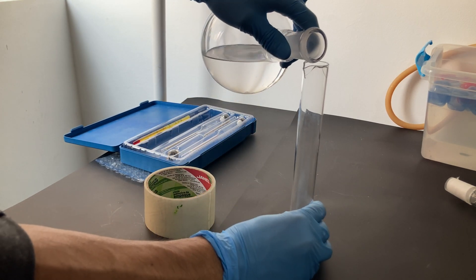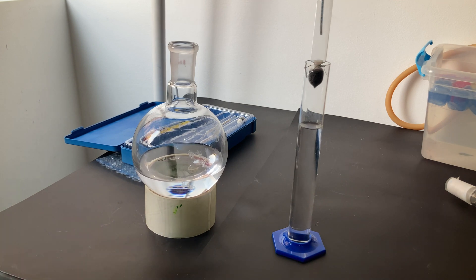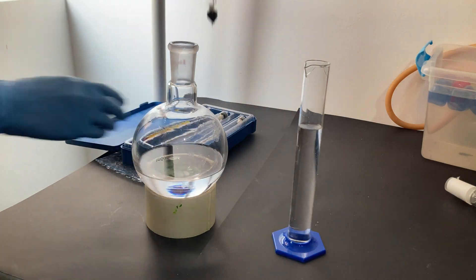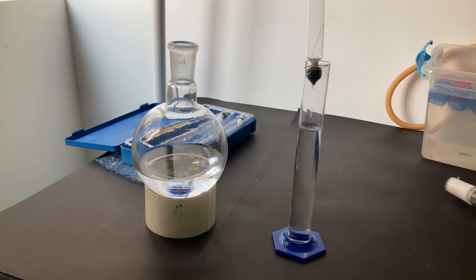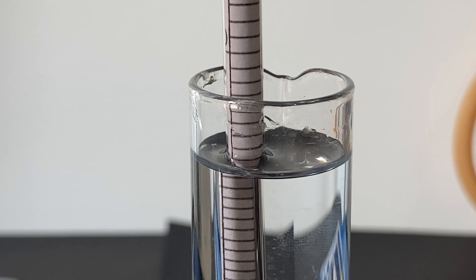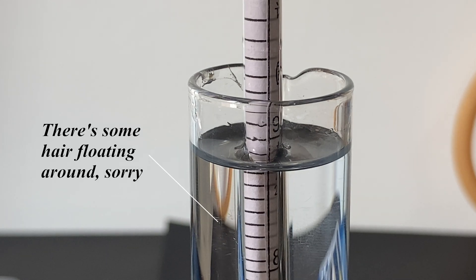After the distillation, I needed to measure the concentration of ethanol, which can be tricky. However, we as humans seem obsessed with ethanol, and we've figured out methods and devices to reliably determine the concentration of ethanol in aqueous solutions. What I am using here is an alcohol meter, a device that actually measures density. It's just a glass tube with some marks on it, and depending on the density of the solution, the tube will sink or float. The density depends on the concentration of ethanol, so knowing the density, we can determine the concentration. I have three different alcohol meters, each for a specific range: one from 0 to 40%, another from 40% to 70%, and the one I used most, from 70% to 100%.